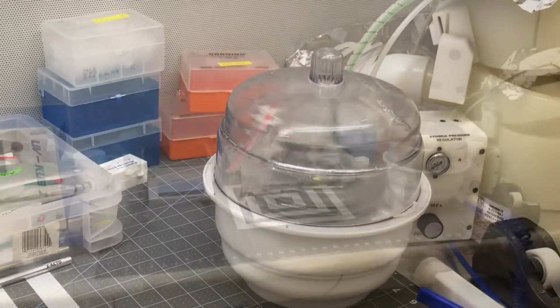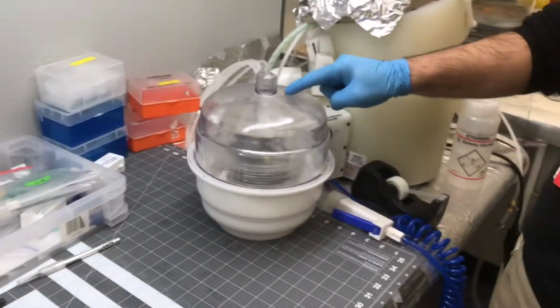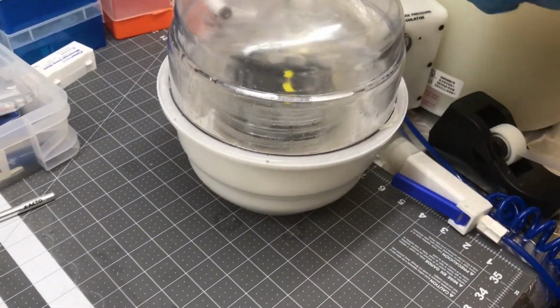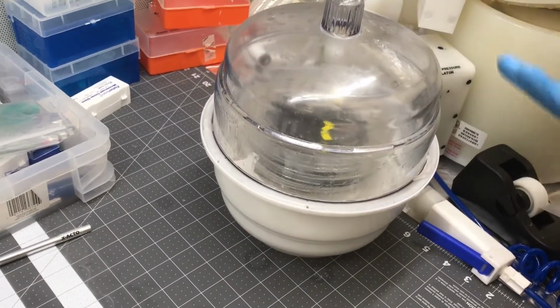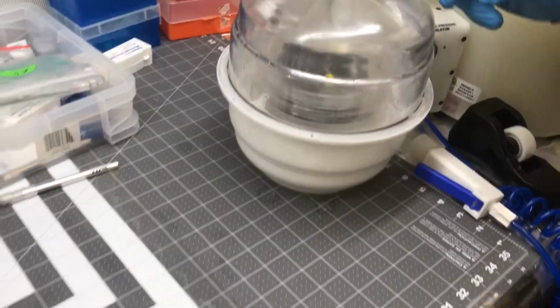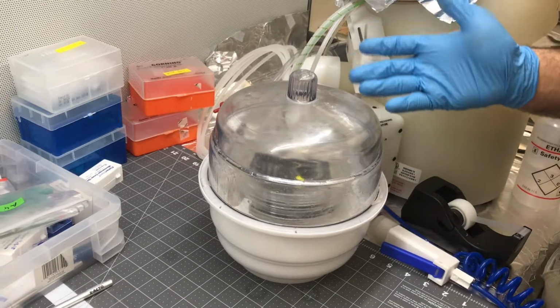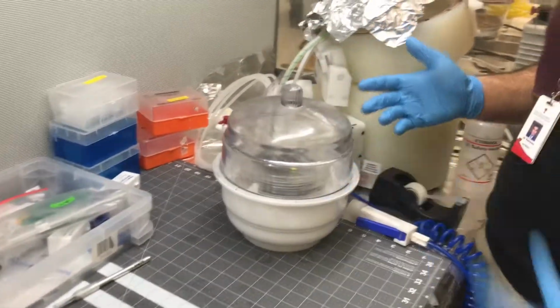So I can pause it now. As you can see here, there is no bubble on the surface that has the structure, because our concern is that the structure should be bubble free. You can see some bubbles around the chip, on the edge. You cannot avoid that. If you keep it for 2 or 3 hours, those bubbles on the edge will also go. But the problem is that when you keep it 2 hours here, it is already cross-linked. You cannot use it, because when you put it in the oven, some part is already cross-linked.